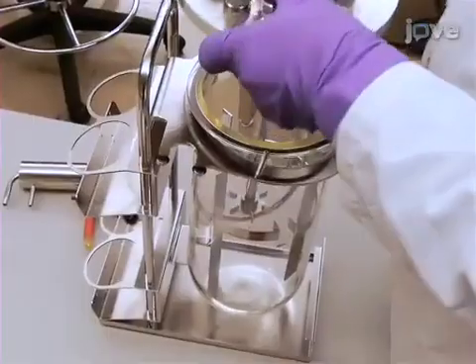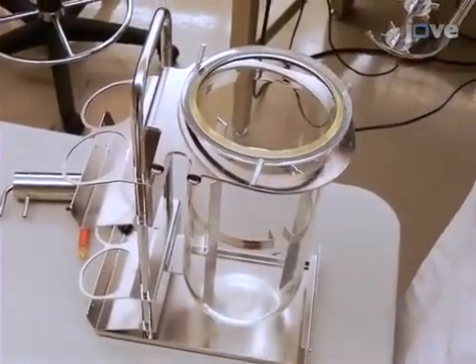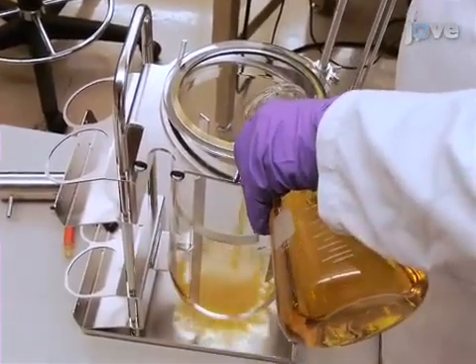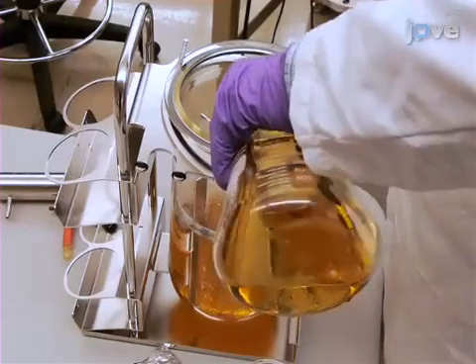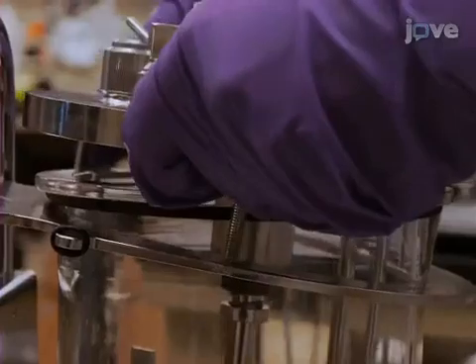Okay, let's get started. To begin, add bacterial medium that is not heat labile to the clean vessel. Only add until maximum working volume is reached, which is 3.3 liters for a 5 liter total volume vessel. Mount the vessel headplate, ensuring proper fit.